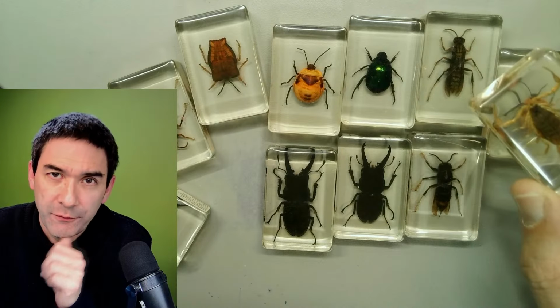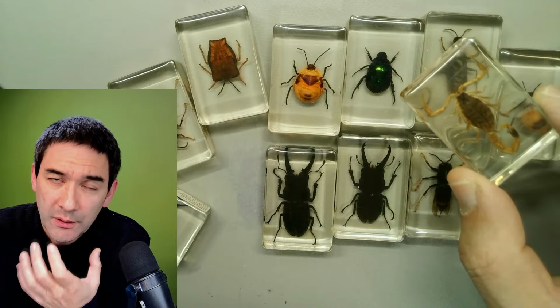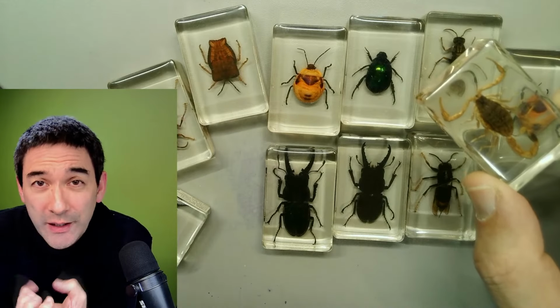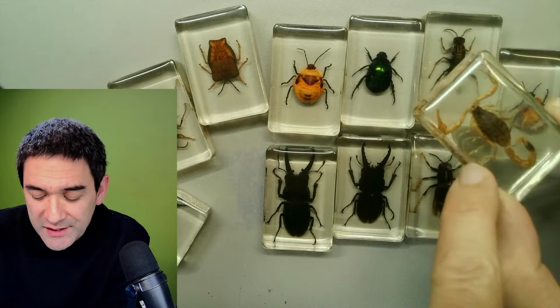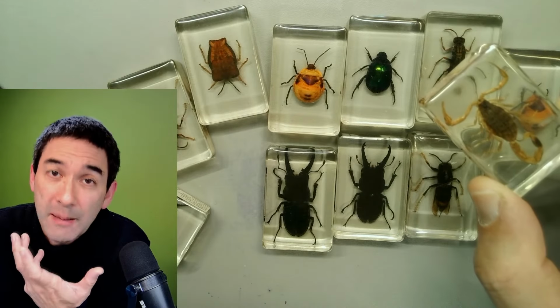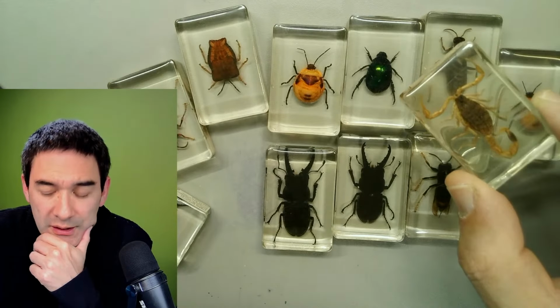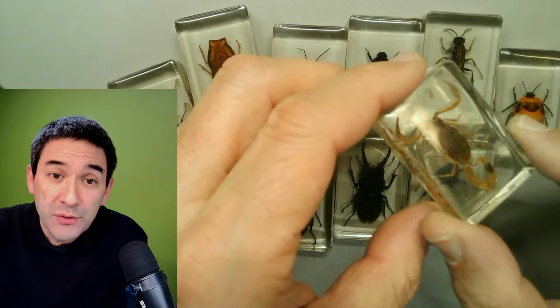But it would have the following advantage: many mounting media have a solvent that evaporates, and when a solvent evaporates, it starts to shrink and deform the specimen. But because this is a resin that hardens by mixing two substances, an epoxy-based resin, it should not shrink all too much or at all. I wonder, I have no idea, if it is suitable as a mounting medium as well.